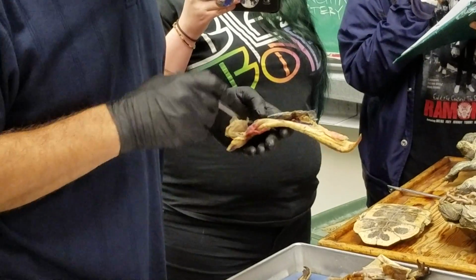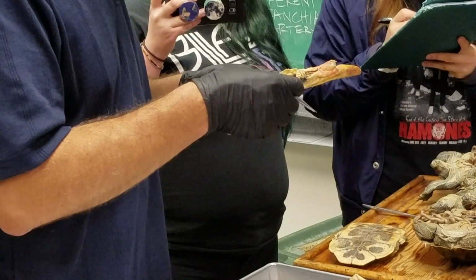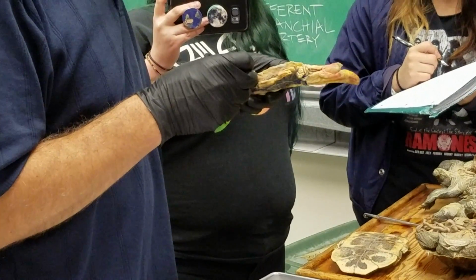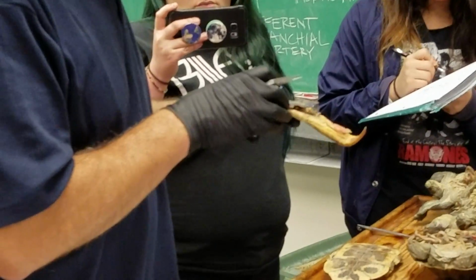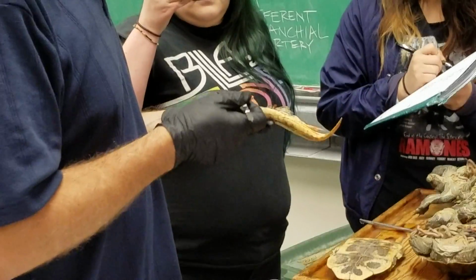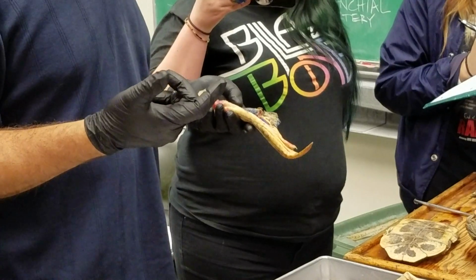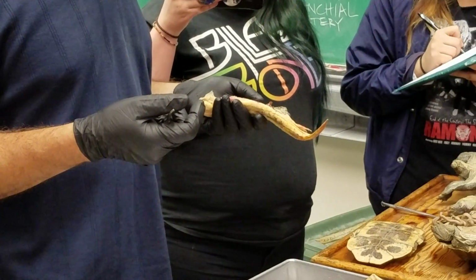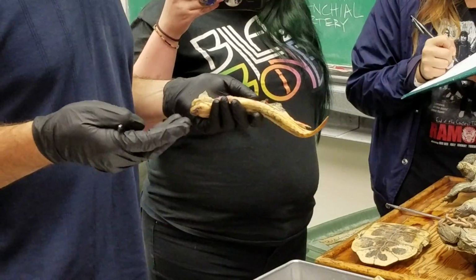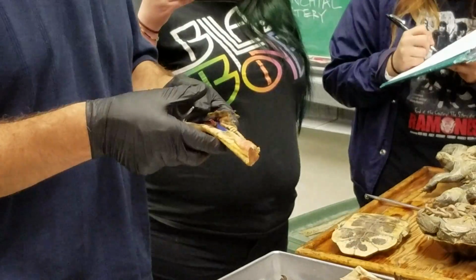I'm really going to skip over some of these smaller vessels because I want to make sure we have time for frogs and turtles. And I'm sort of disappointed with this Necturus. It's not cooperating because we didn't have a really good view of the main arteries coming off the dorsal aorta. The dorsal aorta runs along and it has its usual branches going to the gut. And there's one that goes to the spleen and stomach called the gastric. Then there's a celiaco-mesenteric to the intestine and caudal end of the stomach. And then there's a whole series of intestinal arteries going to the remaining part of the intestine. And they're just not well shown on this Necturus, so it just wasn't well injected for that.